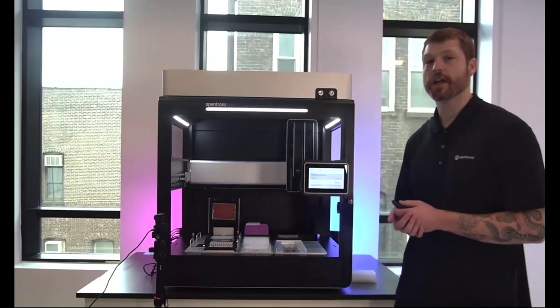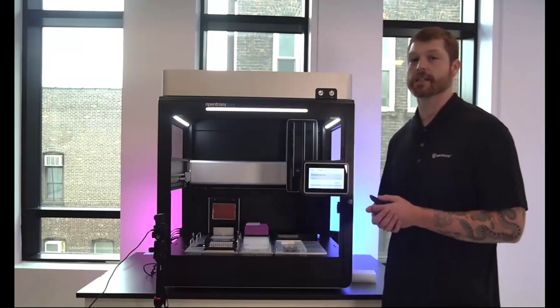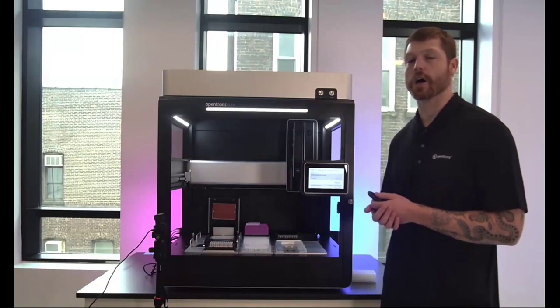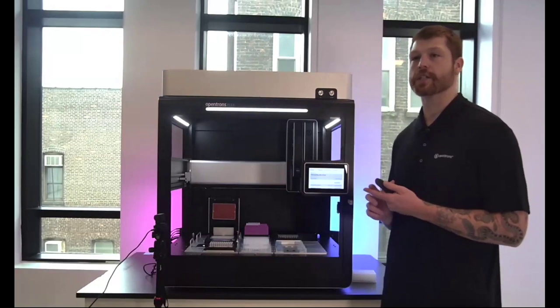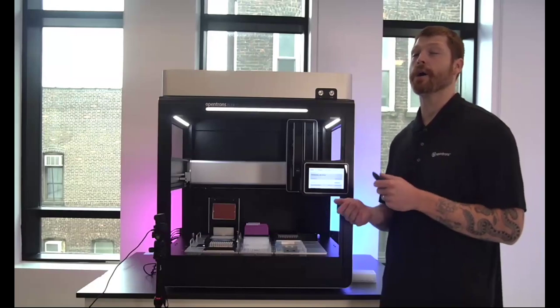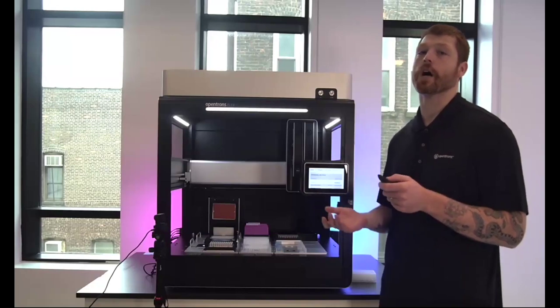Another feature here on the Flex is going to be the on-deck display touchscreen. I'm going to be highlighting this heavily through the demos today, as we are continually striving to have more functionality exist on this touchscreen, giving users the ability to walk up and not only interact with the robot to do things such as calibration of the system and removals or additions of pipettes and modules, but to go forward and do things like starting dynamic runs, and now actually with the newest feature set to script entirely on the touchscreen itself for an entirely walk-up experience.